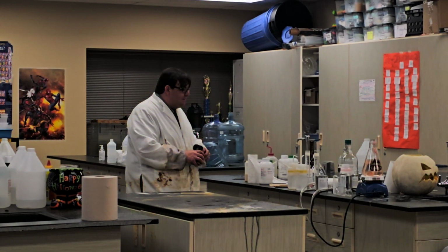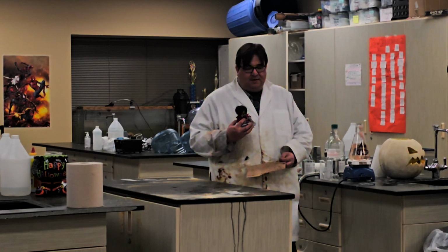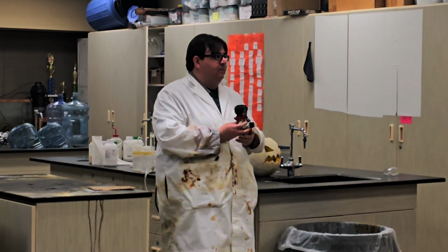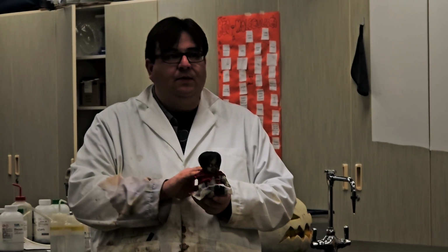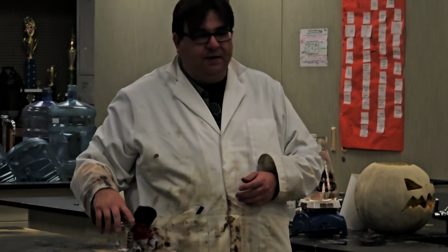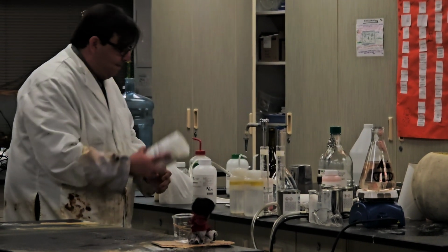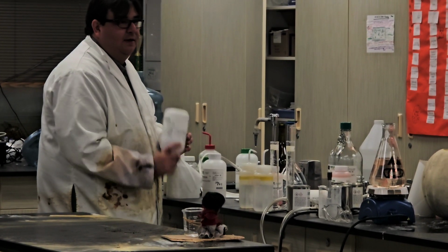So this next one, I'm going to have a little assistant here, okay? My little friend. And my little friend here needs to become possessed. Okay? So to help her get possessed, we are going to use some magic crystals, and we're going to be able to measure how we can tell that she is getting possessed. So, this is super scientific technique right here.